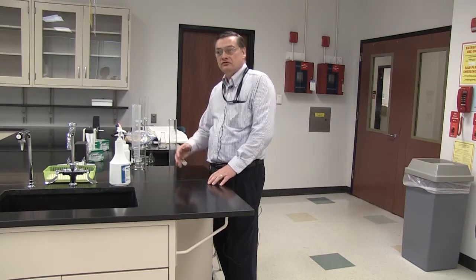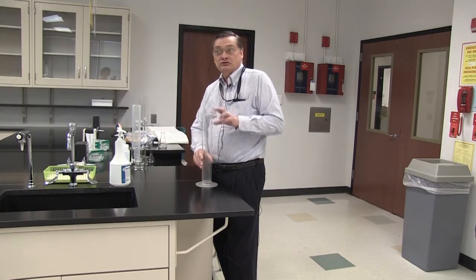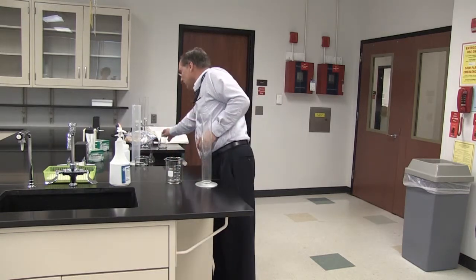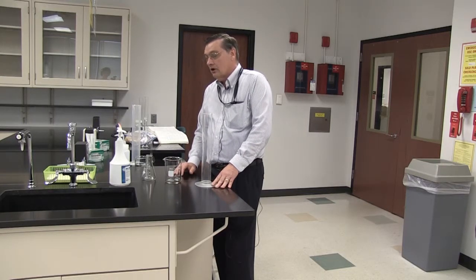As part of our continuing discussion on measurement and measuring devices, I'm going to be discussing for a few minutes the appropriate use of different types of devices and containers for liquid measurement. Specifically, I have a graduated cylinder that we just refer to as a graduate, and also a beaker and an Erlenmeyer flask.